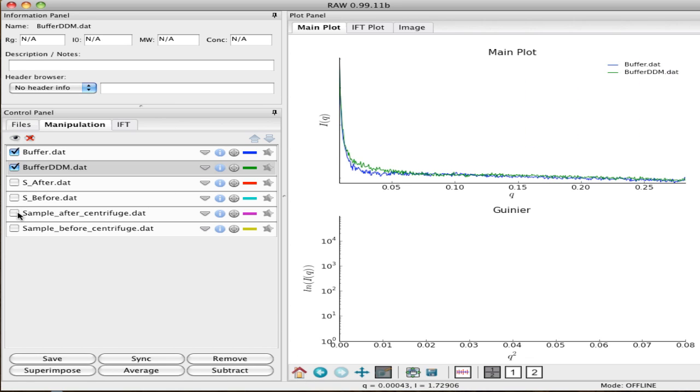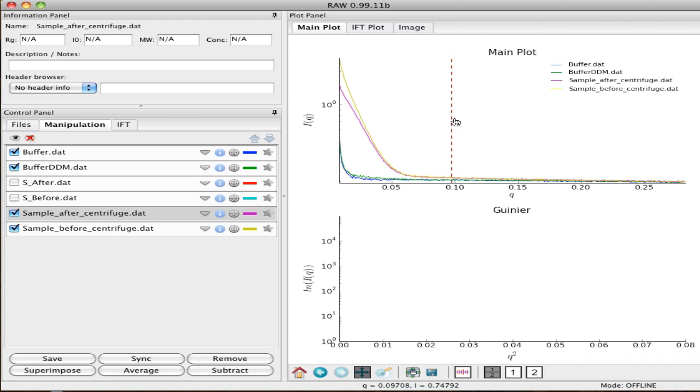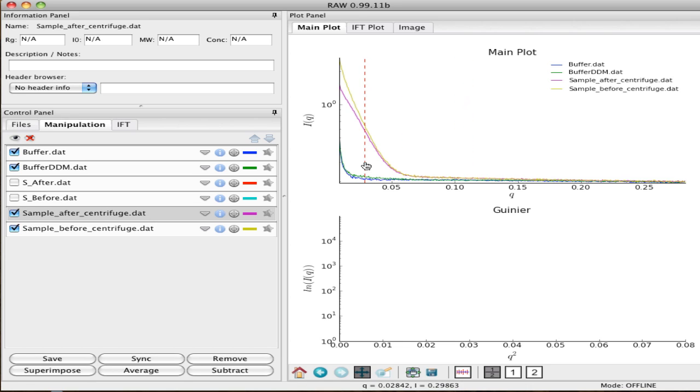Now I'm going to turn on sample before centrifuging and sample after centrifuging. You can notice already that there's been a change here. Before centrifuging you have this rapid rise of the curve, and I can zoom in a little bit on that. You can see it a little better here, which is usually symptomatic of some aggregation, and after centrifuging things have moved down a little bit. So you could go ahead and subtract those curves if you want.